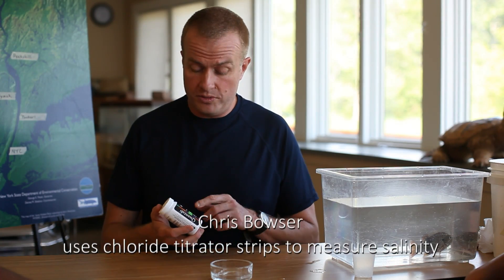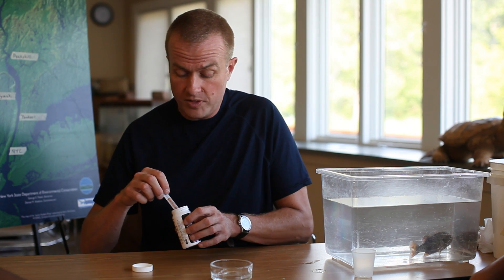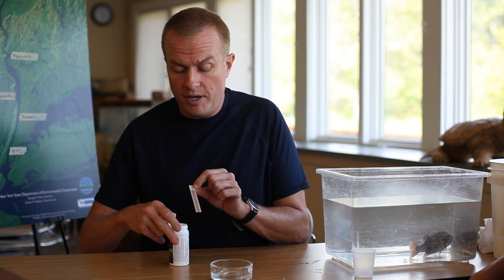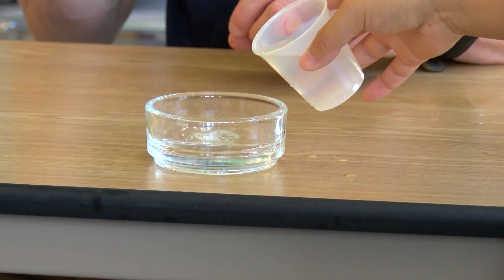Now we're going to use a different device — little titrator strips called Quantabs — that will measure the salinity or the chlorides in fresh water or water that's nearly fresh. This is great for measuring very low levels of chlorides that you might find in tributaries of the Hudson or the upper Hudson River. We're going to take out one of these little Quantab strips and be very careful to hold it at the very top, above the numbers. Can you put about a quarter inch of fresh river water in this Petri dish here?